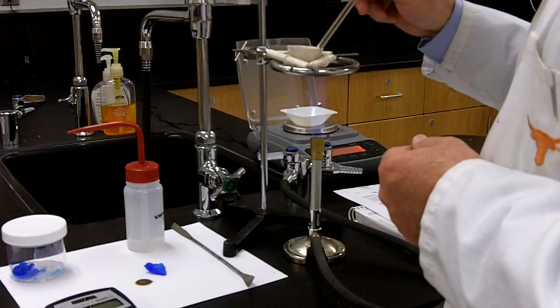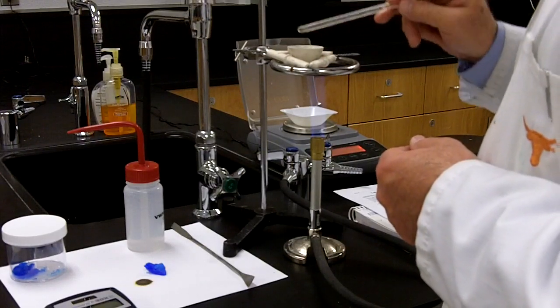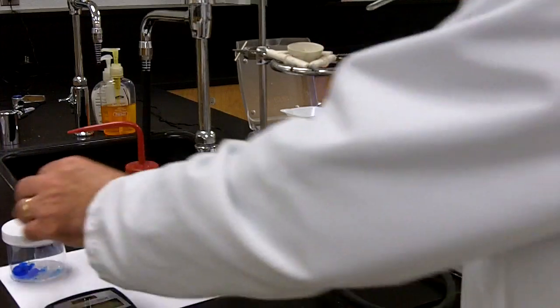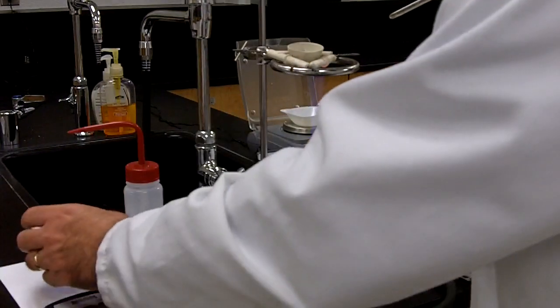The key again is there's no real advantage to using a large crystal. So don't pick a large crystal out of the container that you're given.